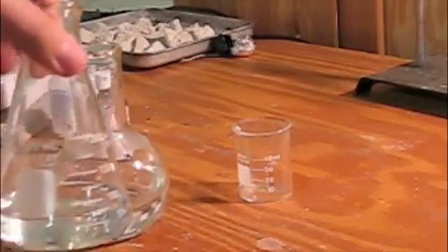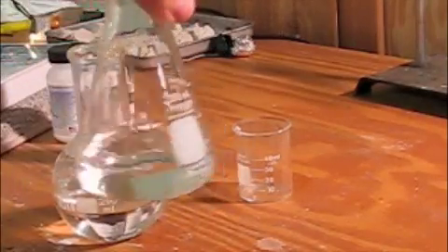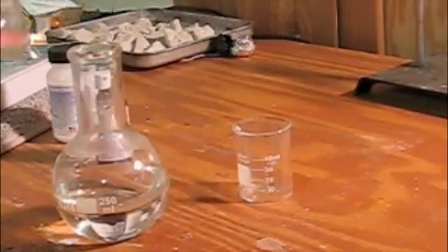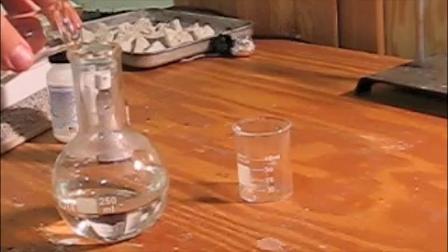The iodide particles will be released into solution when it reacts. Here we go.